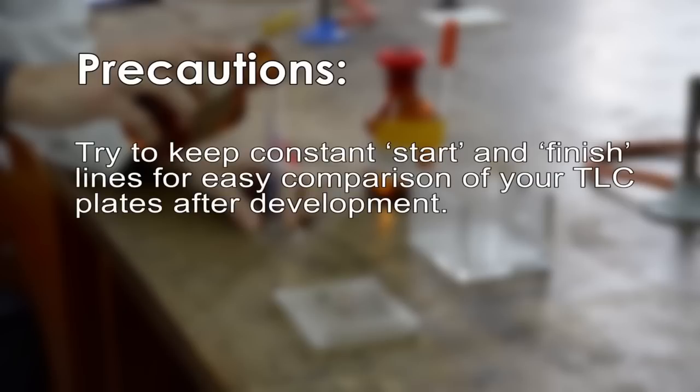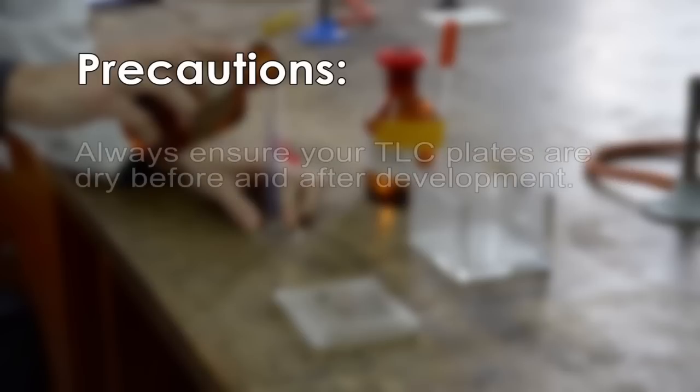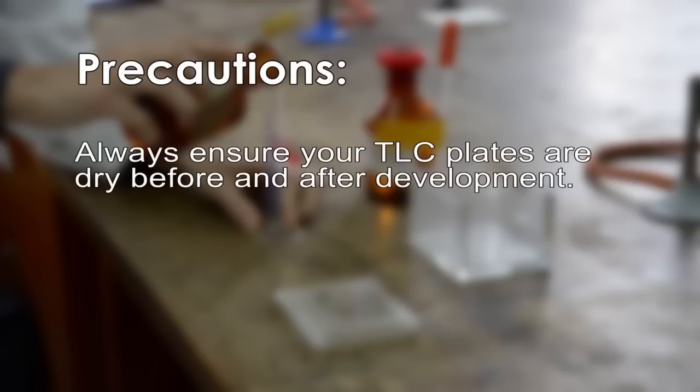Try to keep constant start and finish lines for easy comparison of your TLC plates after development. Always ensure your TLC plates are dry before and after development.